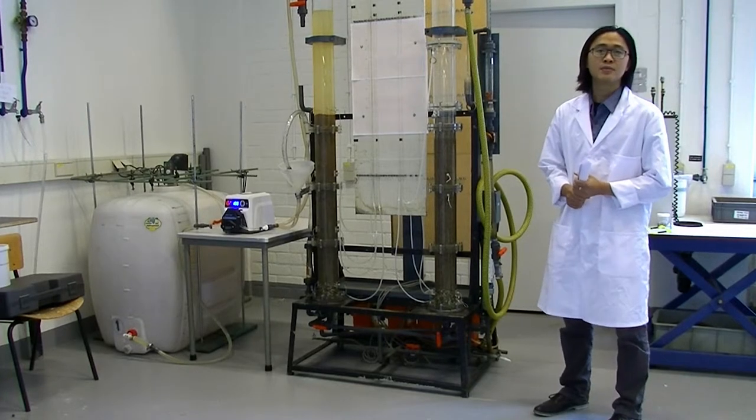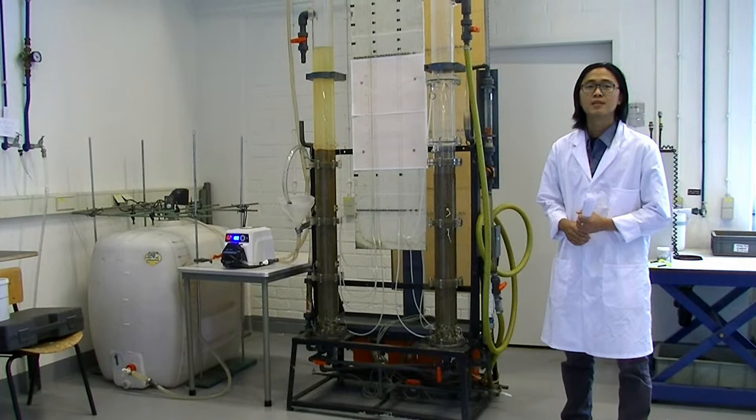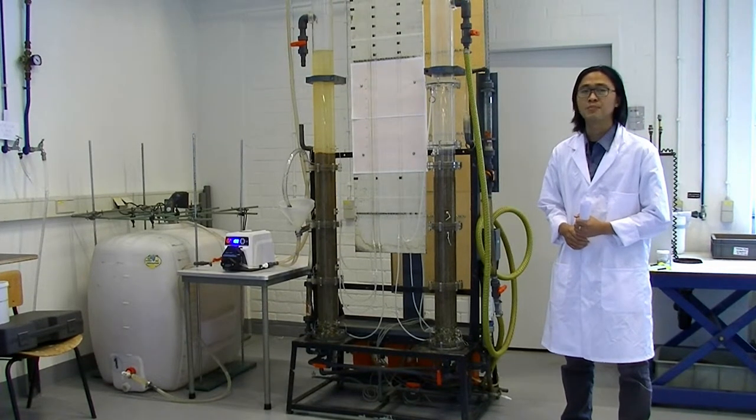Our experiment today is designed to study turbidity removal and head loss development using a column filtration setup we have in our laboratory.